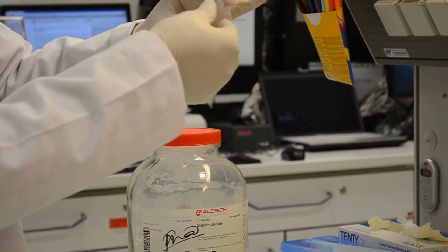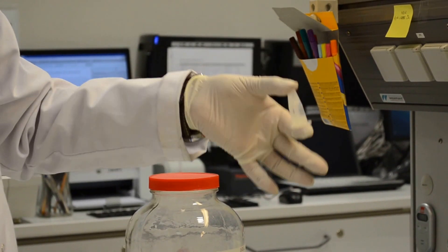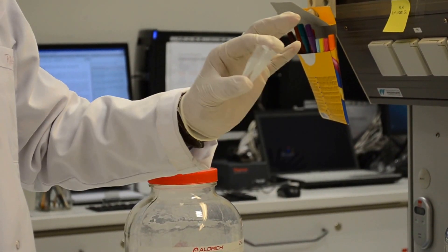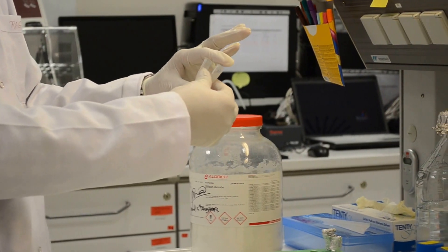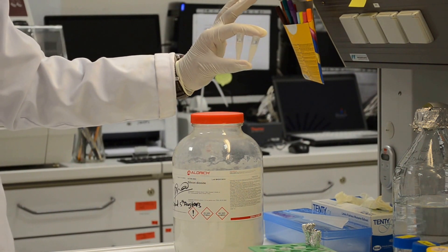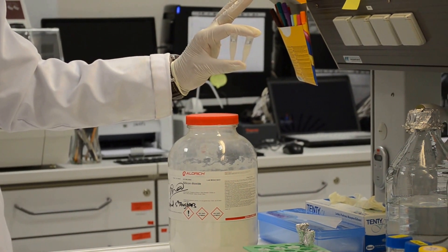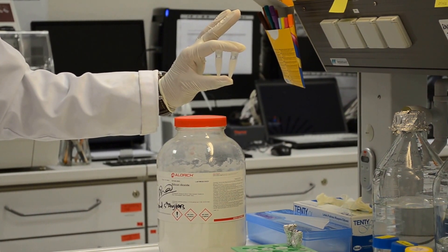This requires mixing for about 2 to 3 minutes, and we will come back after 2 minutes. The tubes were just mixed for 2 to 3 minutes like this. And then we will try again to check its UV emission in the UV light.